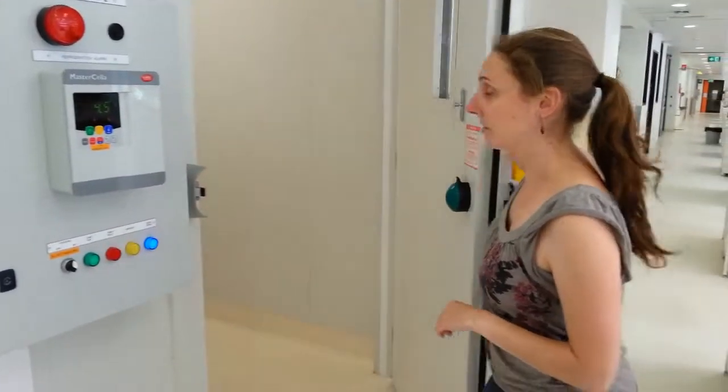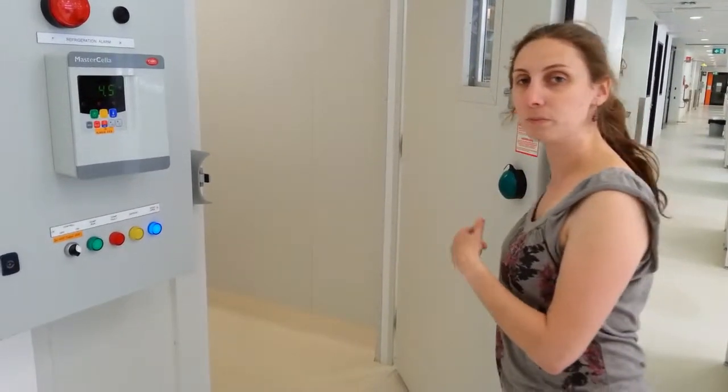This is the dirks room. Wait, what? It's basically this is the cool room. Why? What did I say?